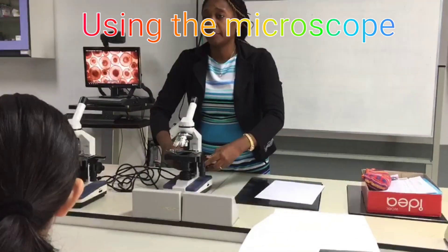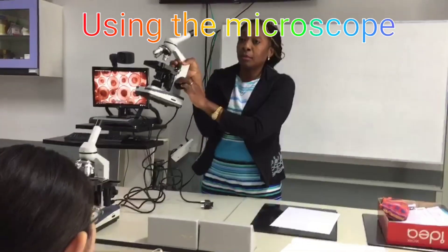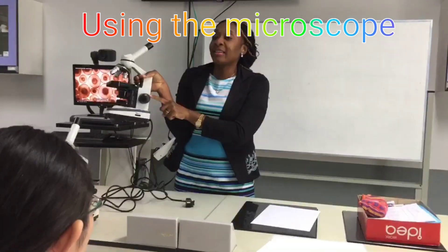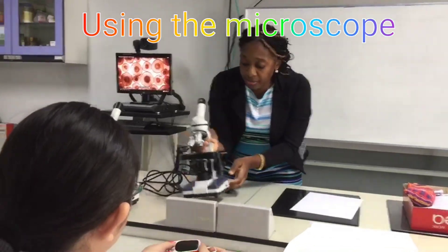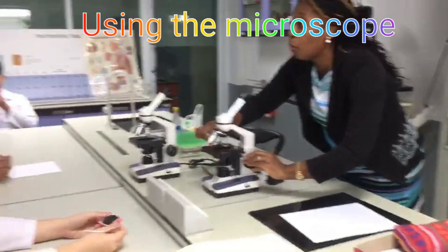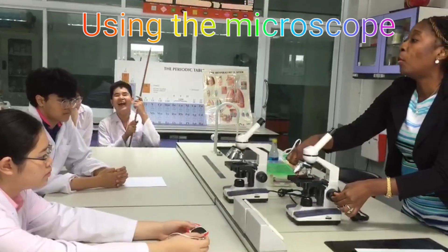This is the coarse adjustment knob. This is the fine adjustment. So with the coarse adjustment knob, it's going to move the stage up. And then you will use the fine adjustment to adjust more.